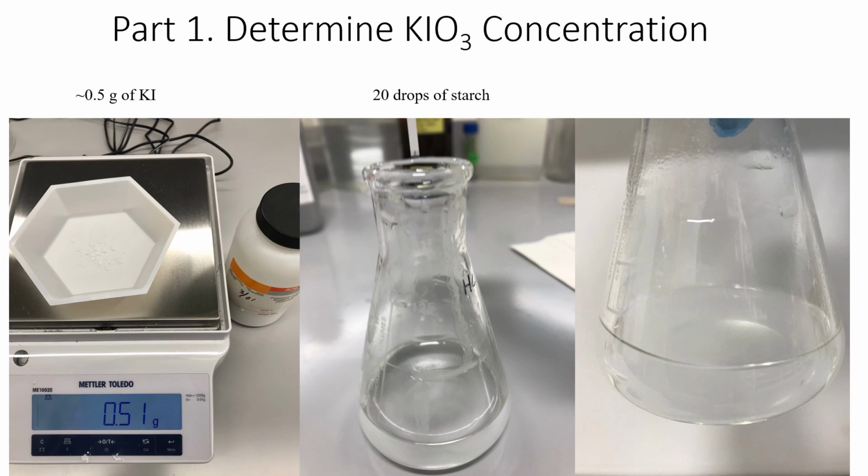So in the picture on the right, you can see this is the final mixture. Again, it contains this dissolved potassium iodide, it also contains this ascorbic acid, and also the starch, and also the hydrochloric acid. So the cloudiness is due to the starch, okay?